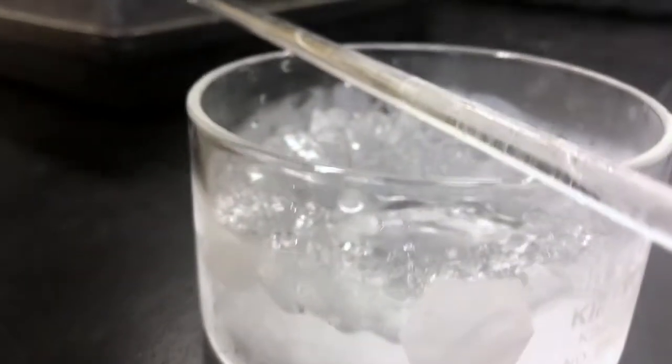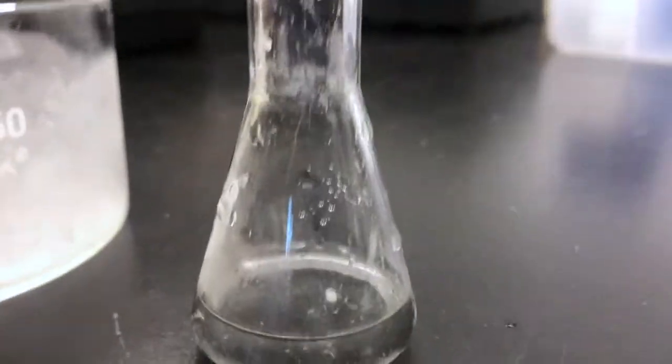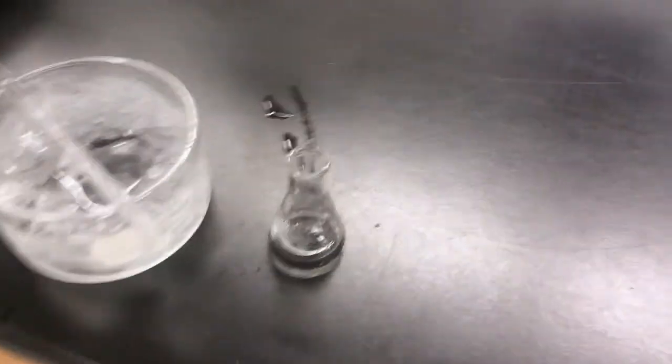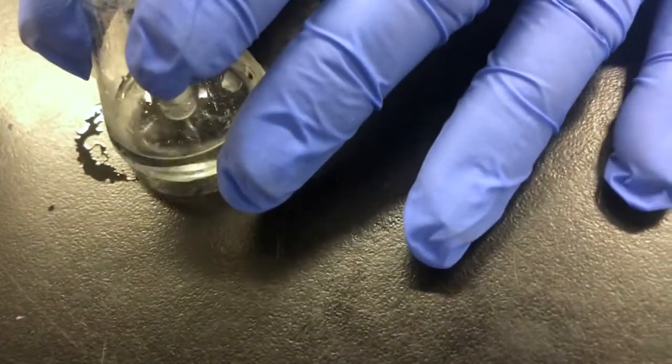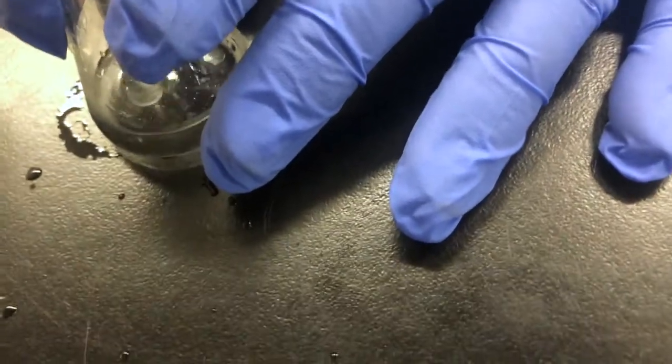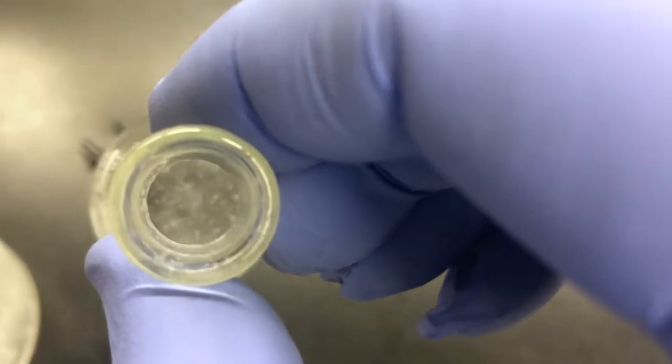Let it sit at room temperature for more than half an hour here, and just did not see much in the way of crystallization. At this point, I tried to scratch with a glass rod to try and induce crystallization. This can often act as a way to form some seed crystals. And you can see there's some solid that forms on the stirring rod as the solvent evaporates off of it. Put that back in, it can act as a seed crystal as well. But the solution never really took off in terms of crystallization.